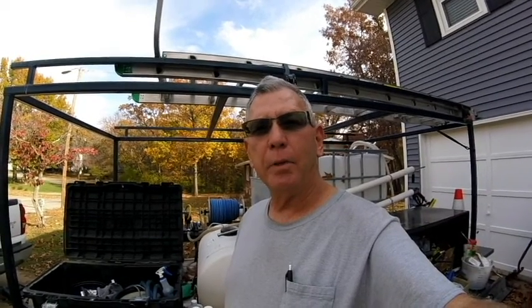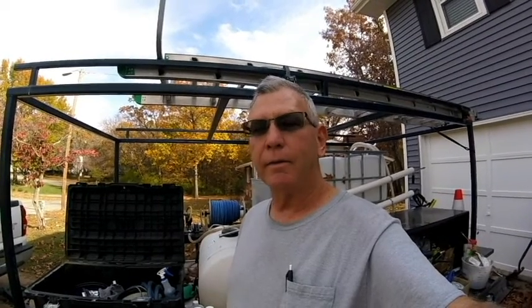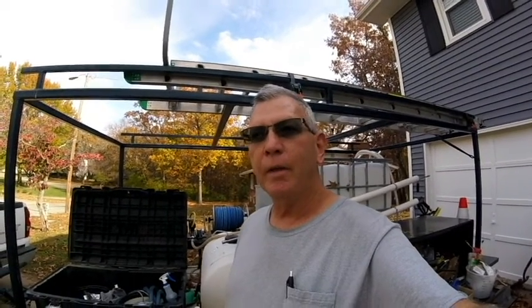Hey everybody, this is Kenny at Kenco Power and Soft Washing. You guys may have seen my prior videos where I was getting screwed on my bleach purchase, so I bought a Lovibond 147,490 bleach high-percentage bleach testing kit. One of my viewers asked me to do a video on how to use the test kit, which is a good idea because it is confusing.